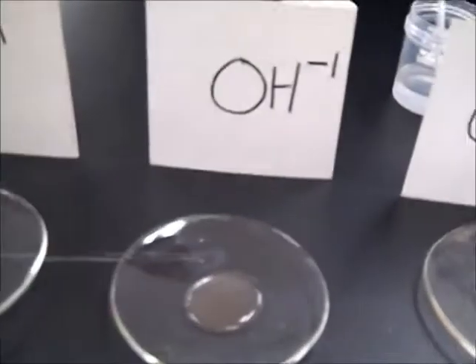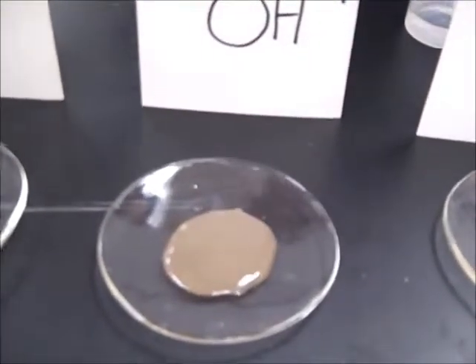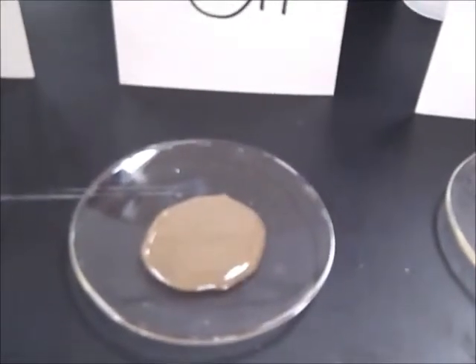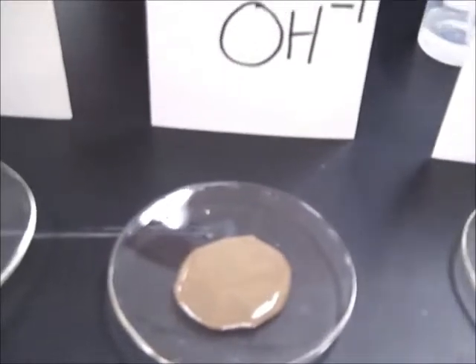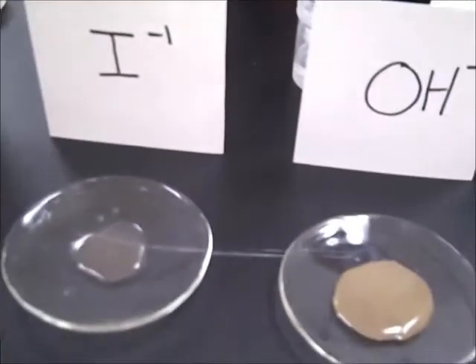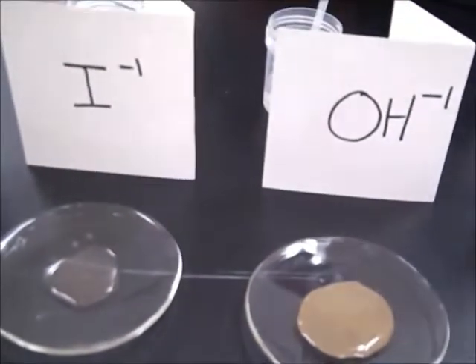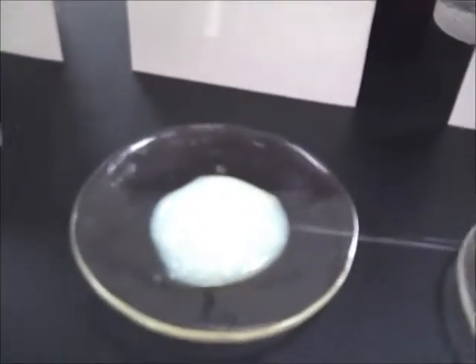All right, so this is going to be the silver with the OH minus. Oh, yuck. We're not going to comment on what that one looks like, but it's definitely of the brownish, greenish nature. Pretty gross. And here is the silver with iodide. Ew, that's pretty gross looking as well.